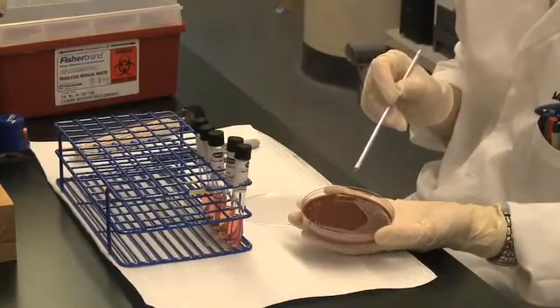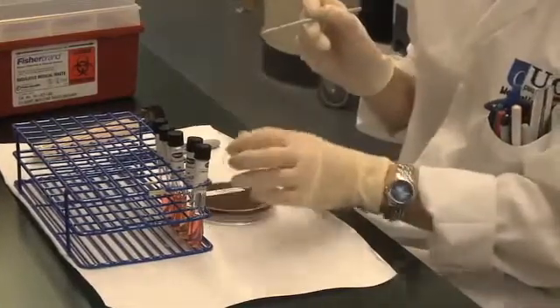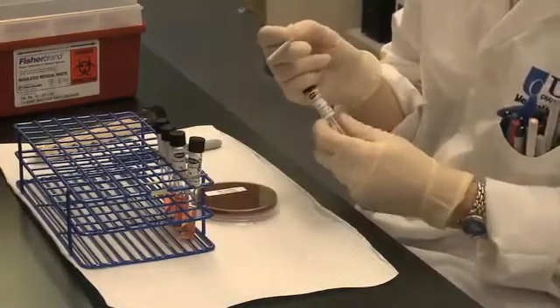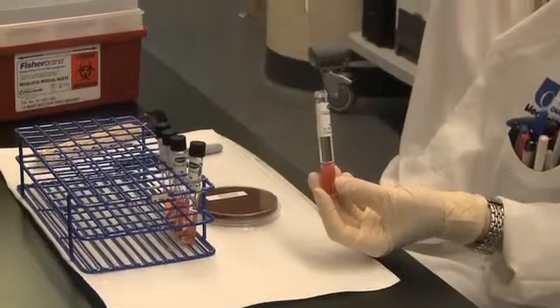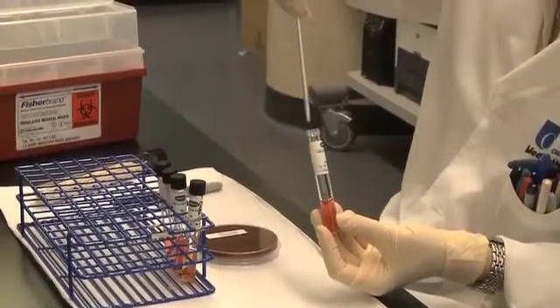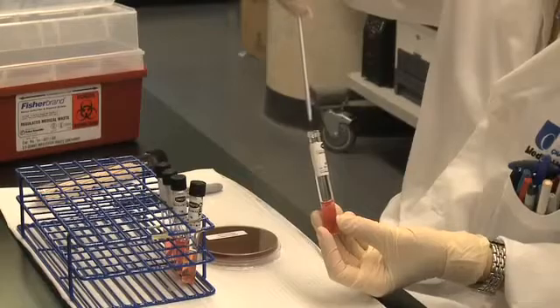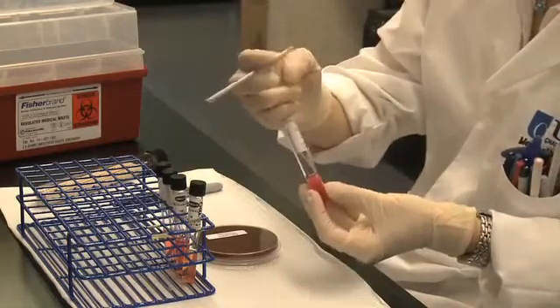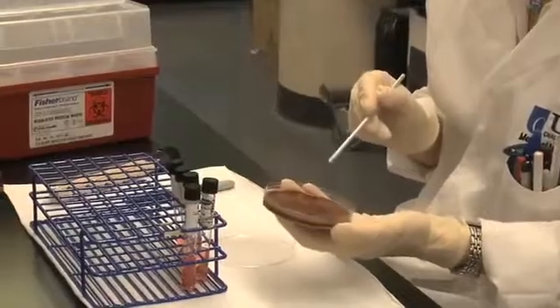Use a heavy inoculum from a purity plate with a loop, and deposit the loop full just 2 mm below the agar surface of each carbohydrate and control tube.